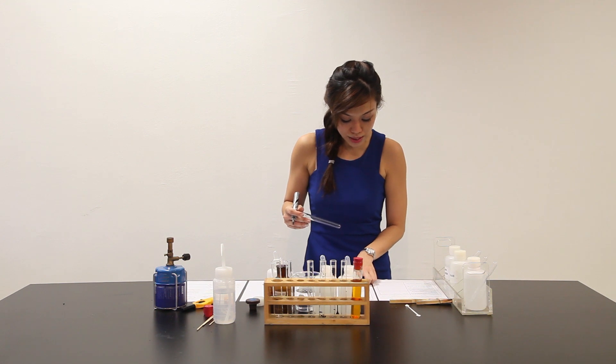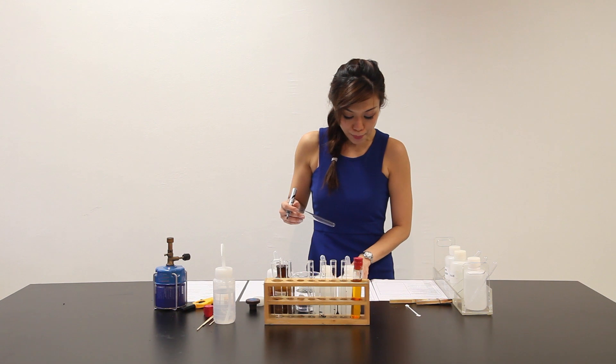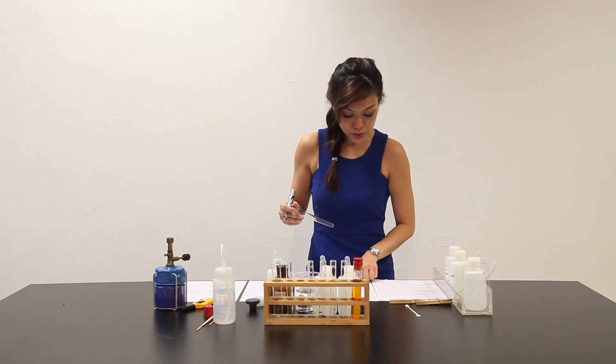And it goes on to say to this test tube immediately add dilute sodium hydroxide solution drop wise with shaking until no further changes is observed. Carry on part E. But continue to observe this test tube for several minutes.